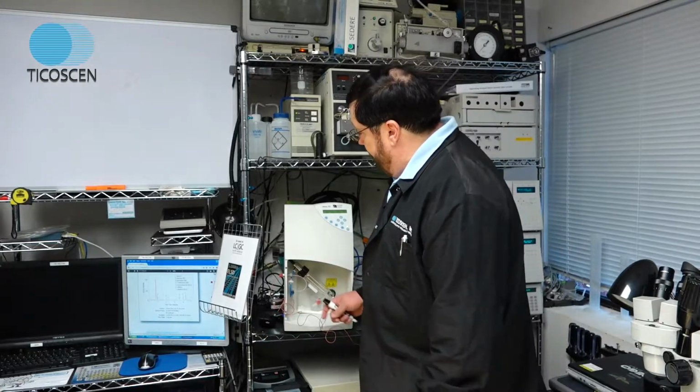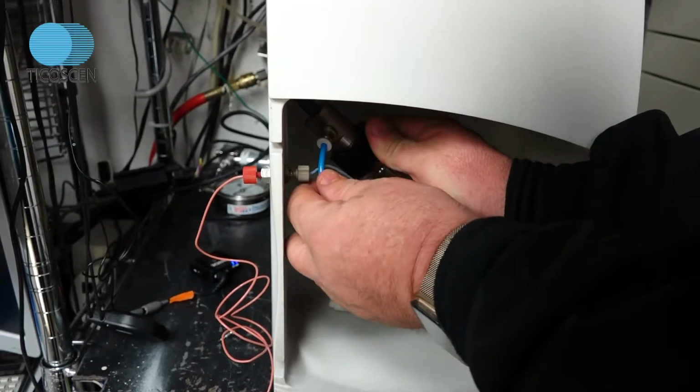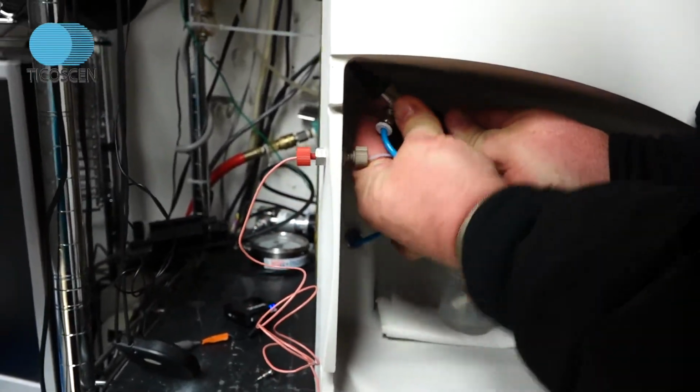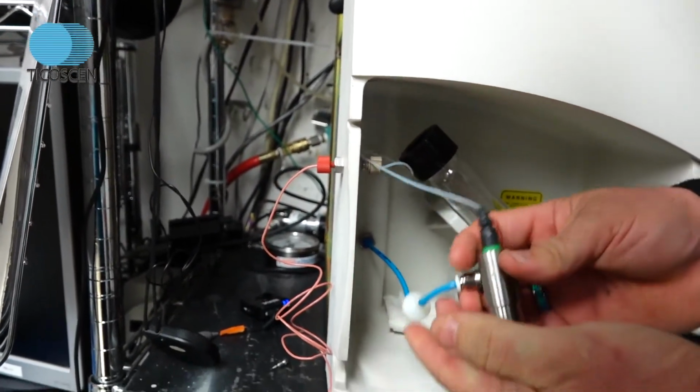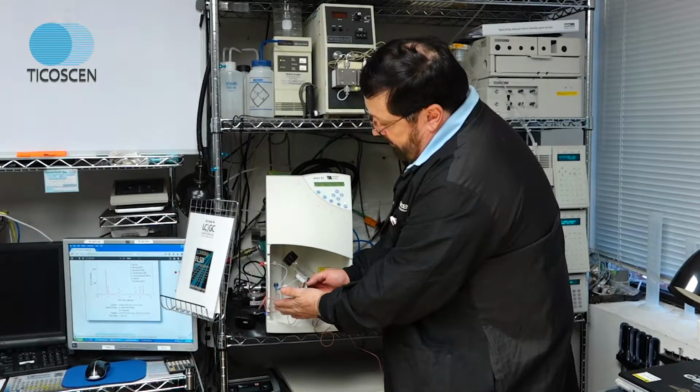First, most likely, your problem with LOD and RSD will be with your nebulizer. Your nebulizer is right here. You just quickly unscrew this and pop it off, and there is your nebulizer. It has a gas input and a liquid input, and it sprays.